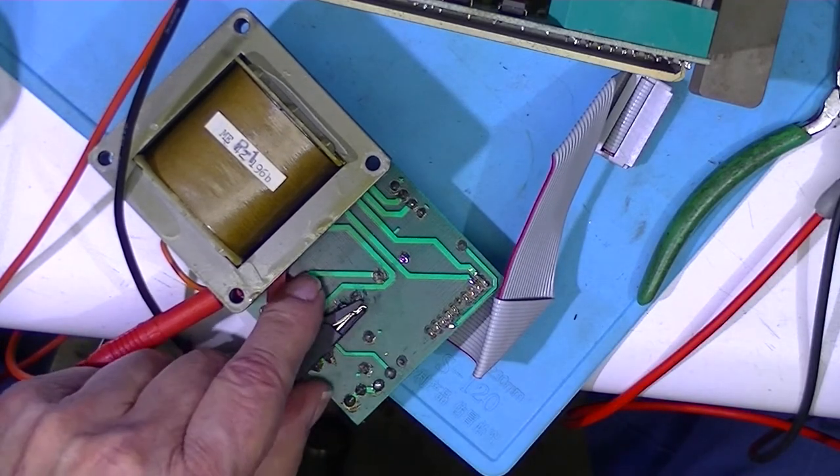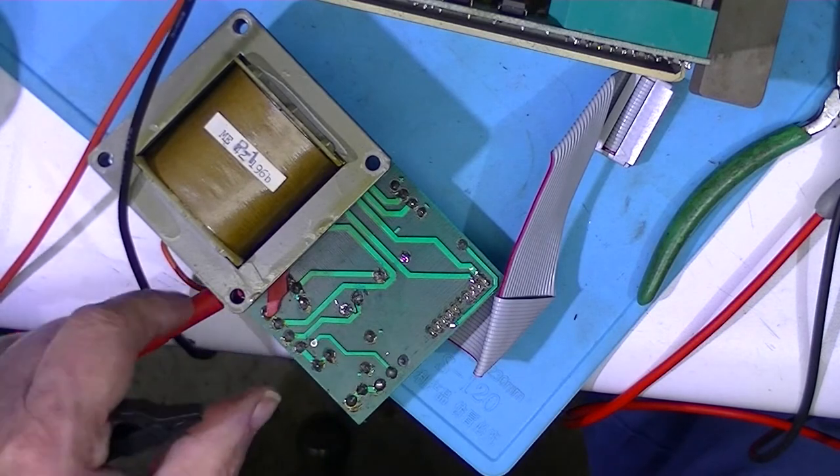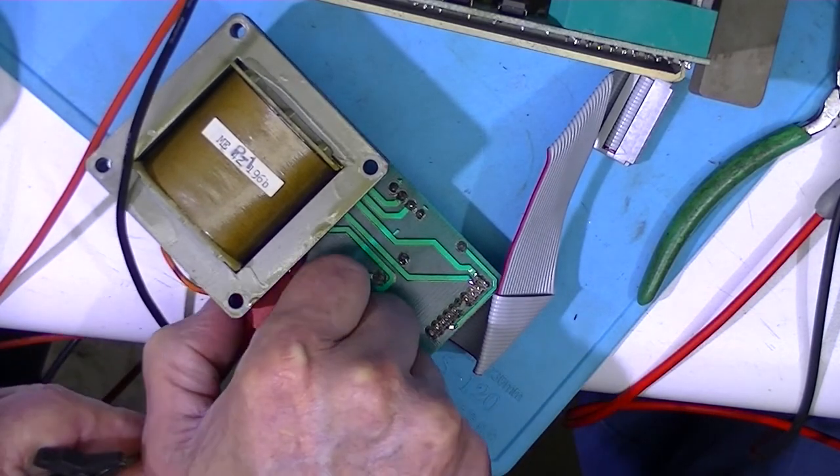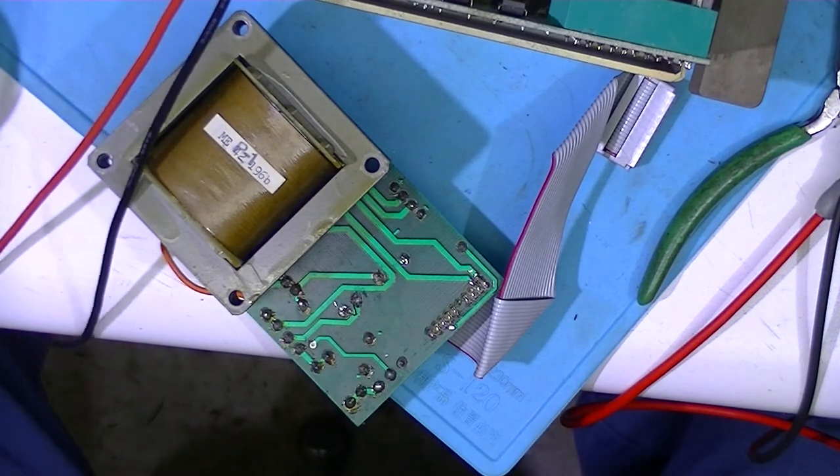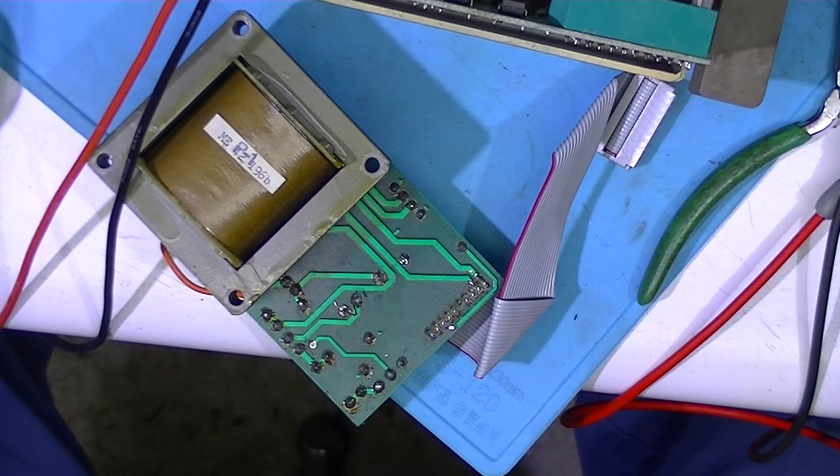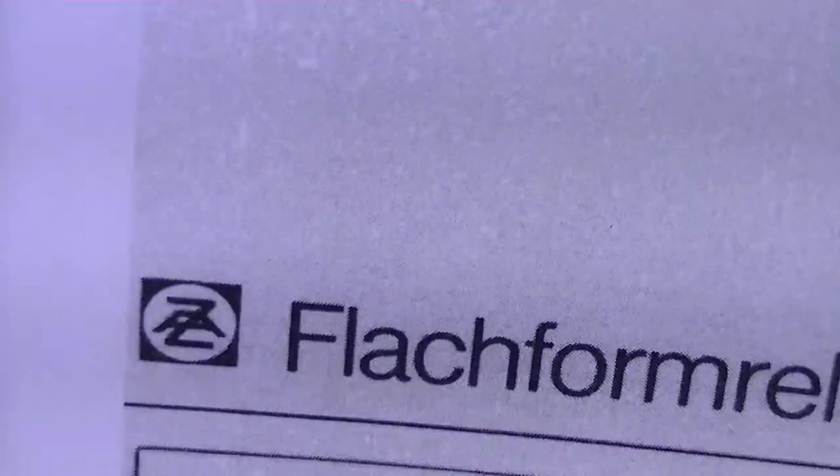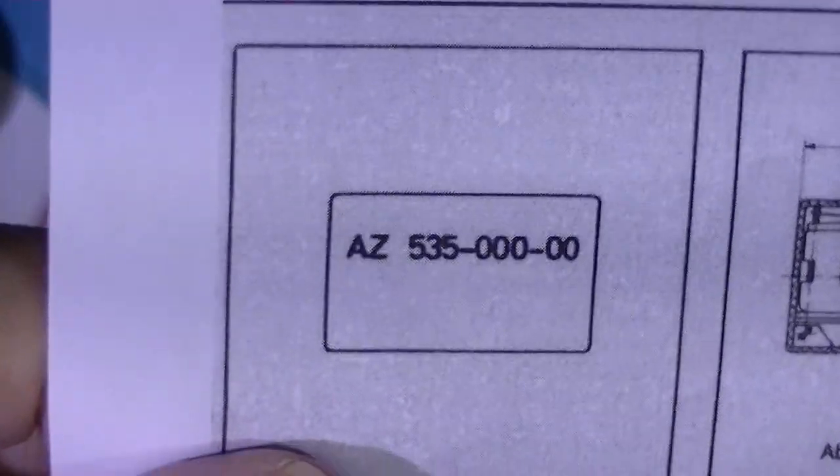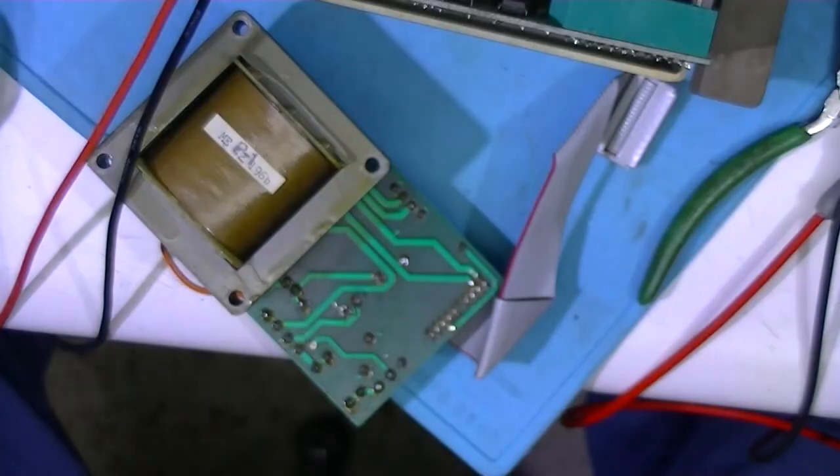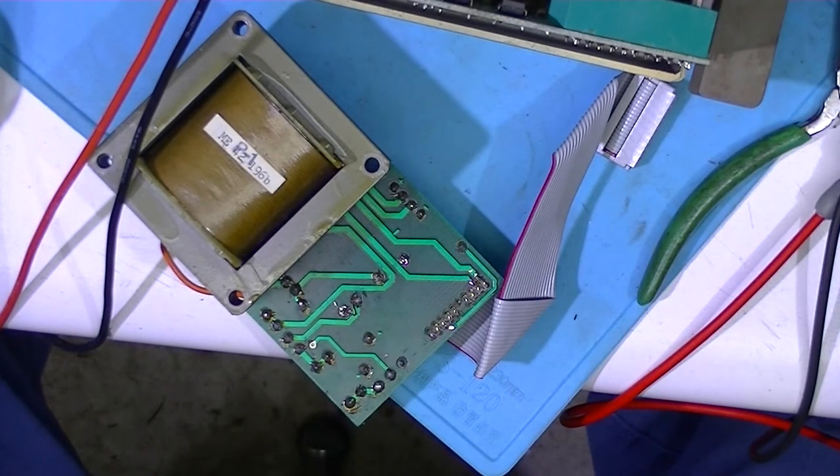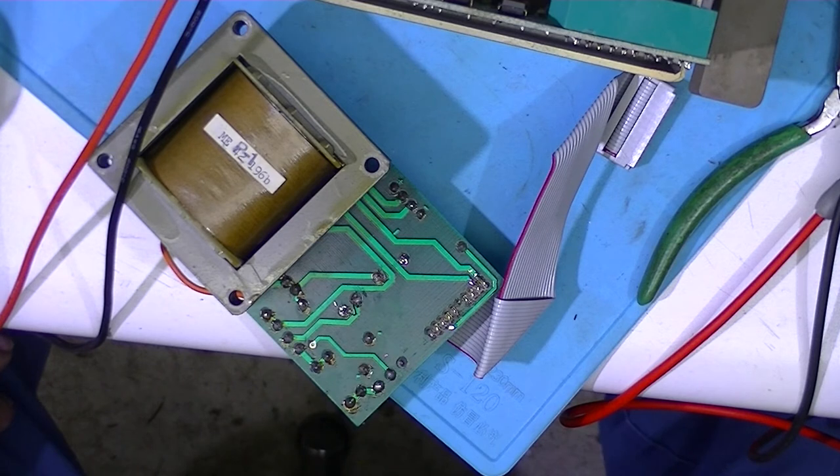I found one of these relays on eBay, only one, and I cannot find an interchange or a cross reference for the AZ-535 series. So I found it in Poland, new old stock. Zettler I think no longer makes this relay and they apparently don't make a replacement for it.